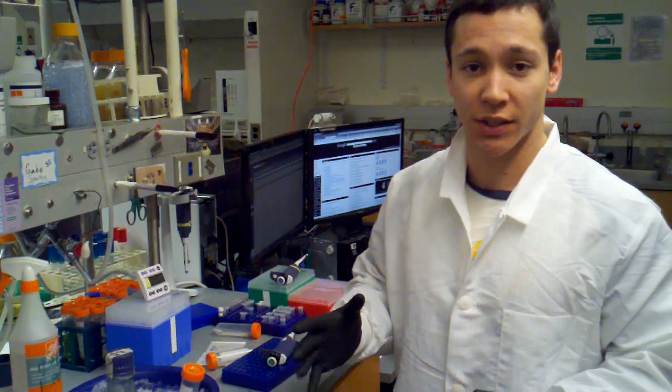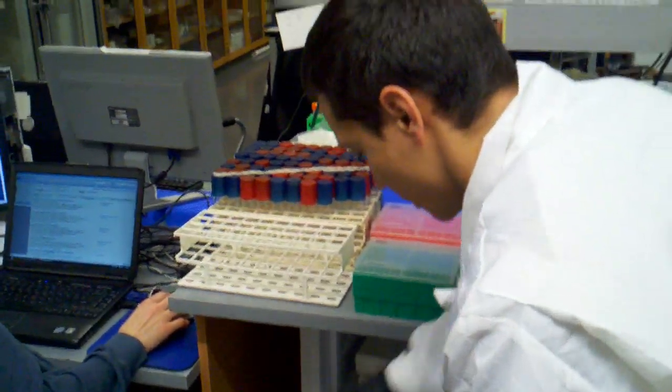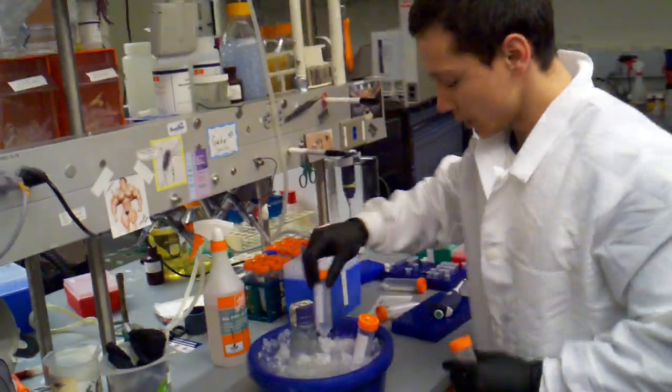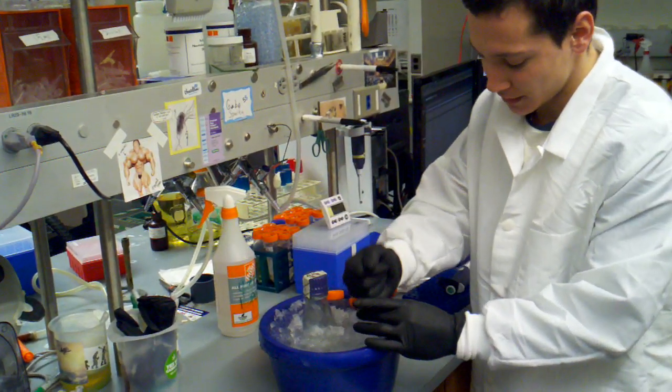And when I did my induction I put some 10% glycerol in the freezer so it should be ice cold right about now. Hopefully not frozen. So here's our 10% glycerol. So that goes on ice. I just don't want it to stick in there.